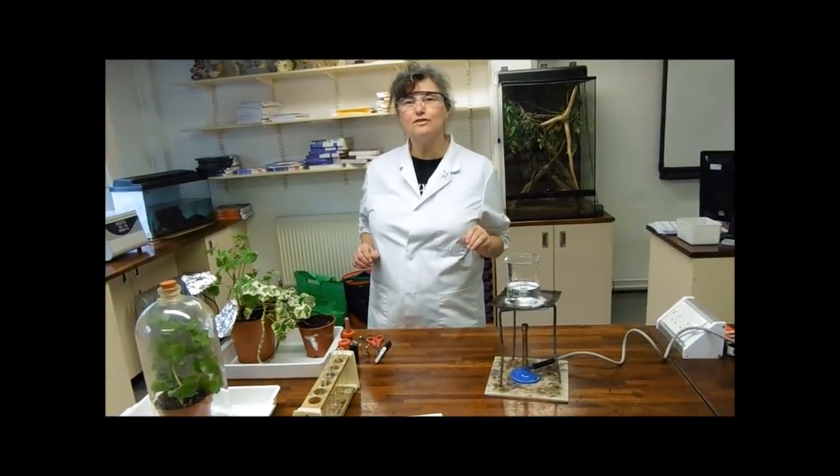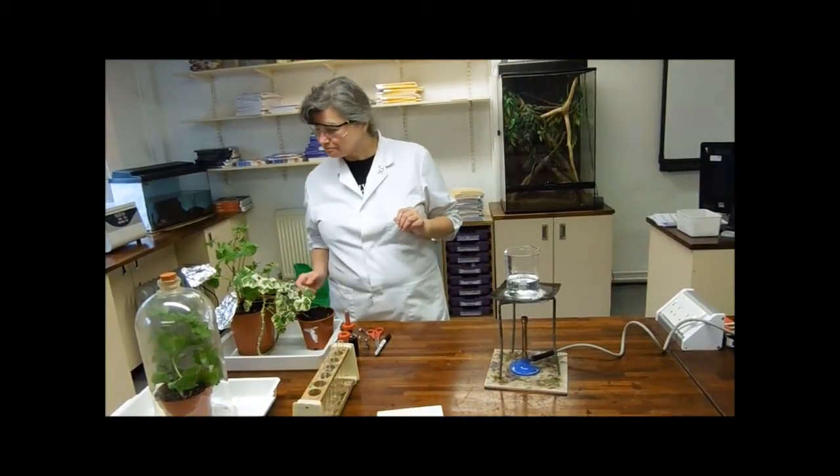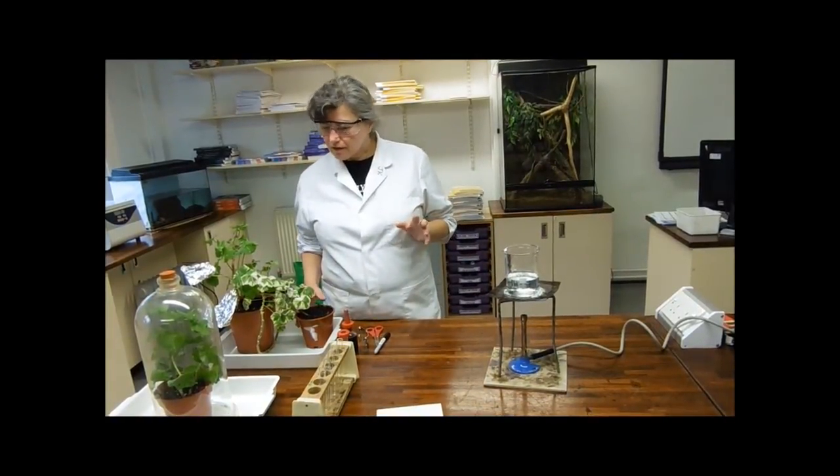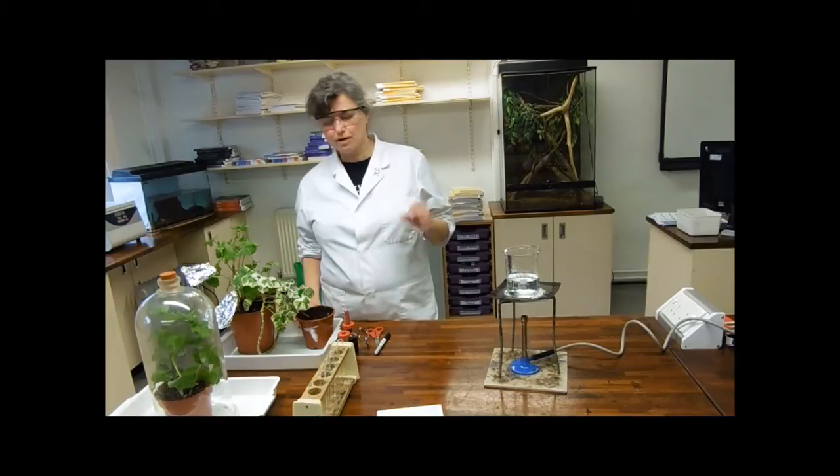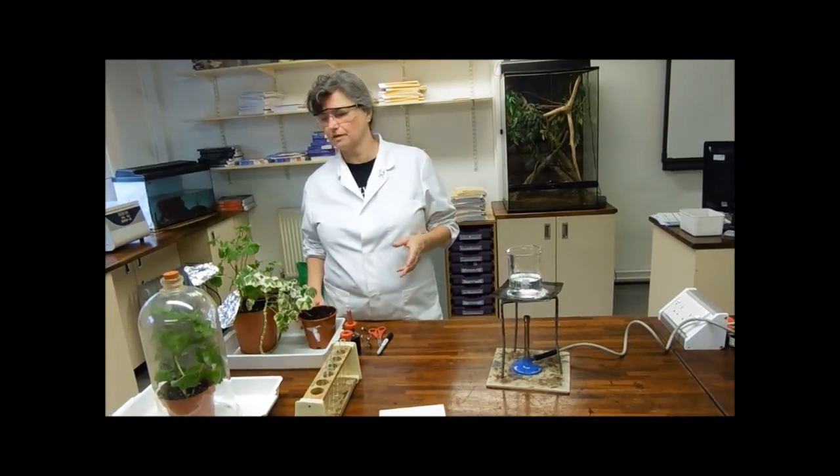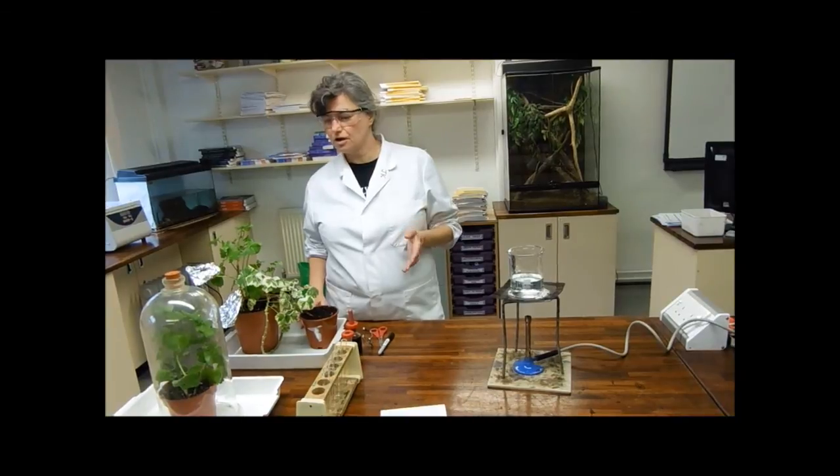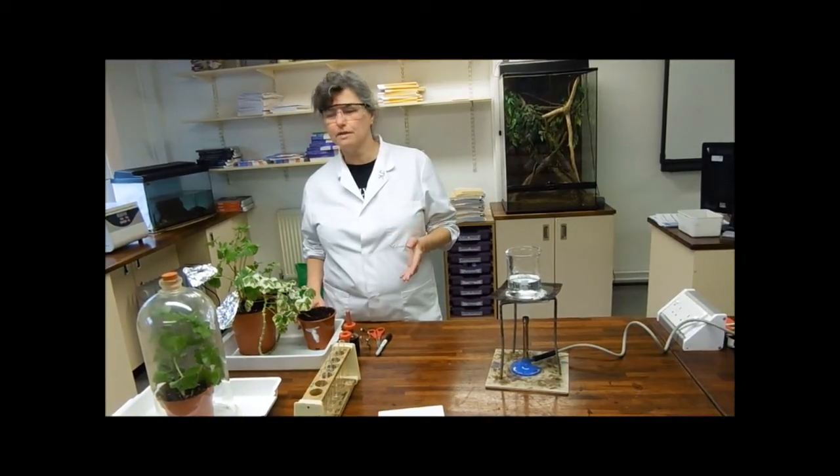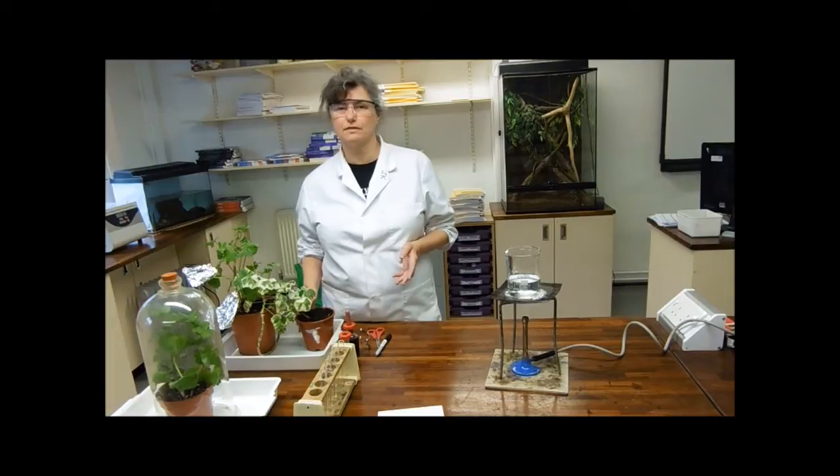Okay, welcome to the world of photosynthesis practicals that you should have done at school. This is a really, very basic GCSE level practical and it's to show the requirements of the various things for photosynthesis.